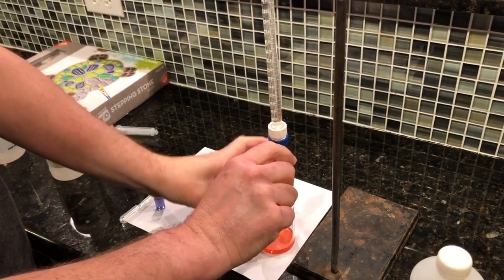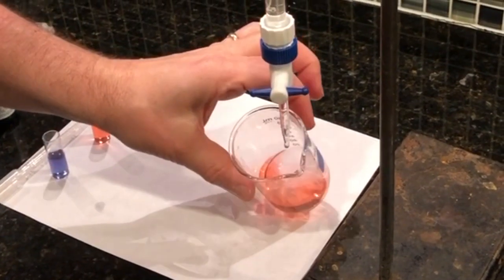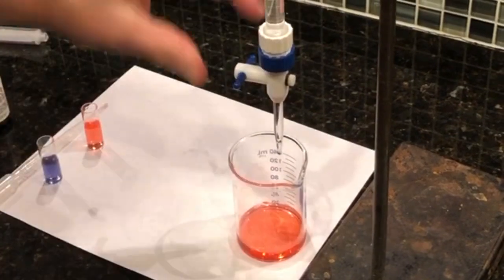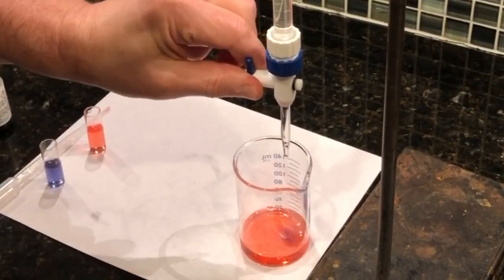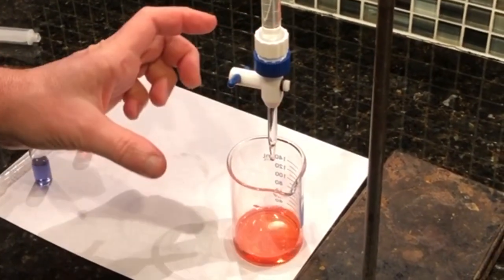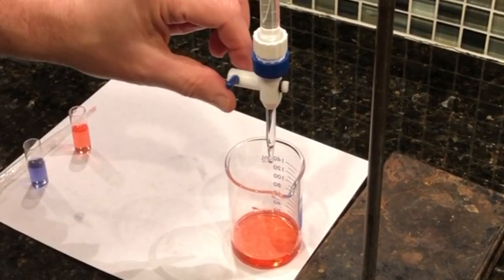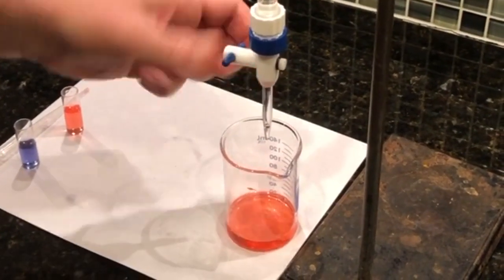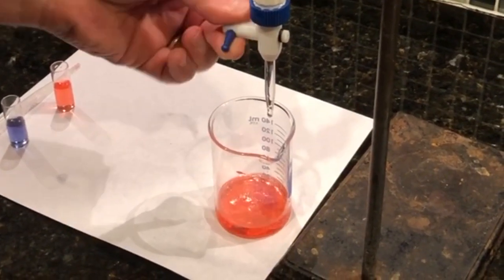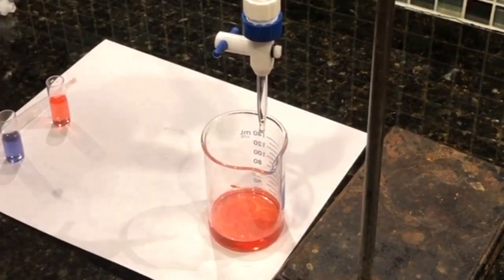And what you'll see is as that base initially goes in there, it's all still acidy. But there's going to reach a point, it's on this side, where that base starts lingering. And then as it reacts with the acid, it becomes water, and then what remaining acid is there remains. So we can put some more in there. And when that lingering happens for a long time, we know we're close to the acid and the base being equal.